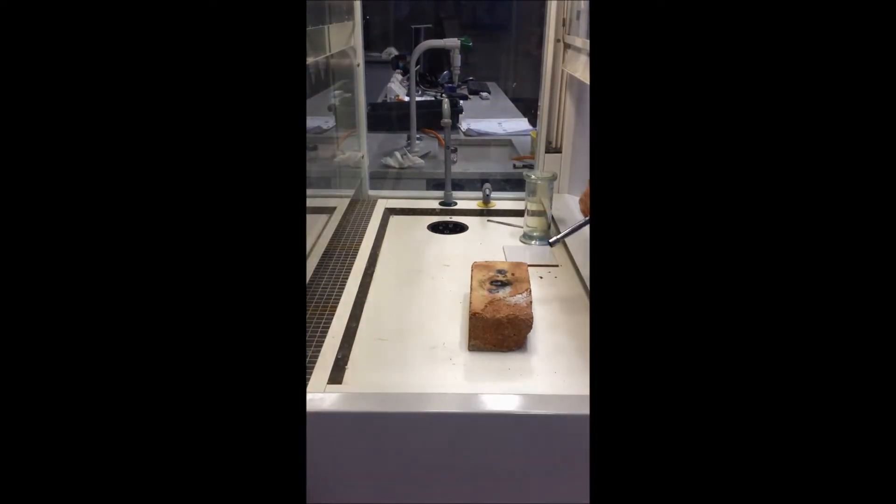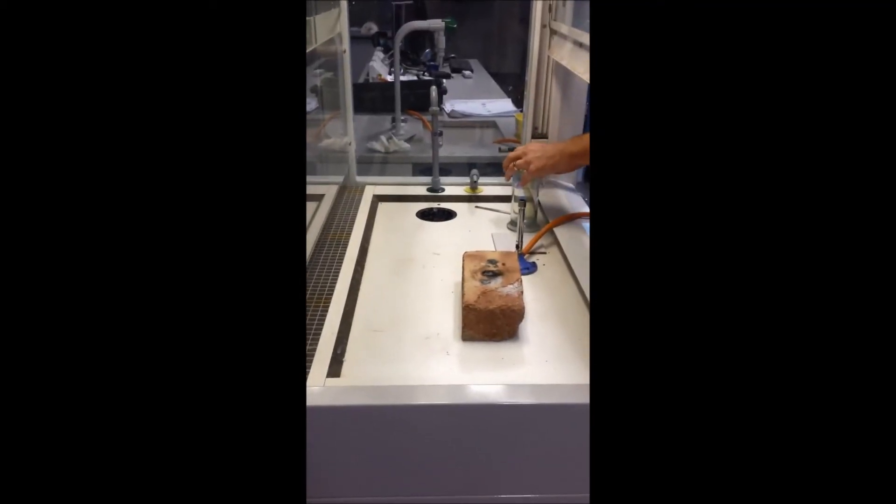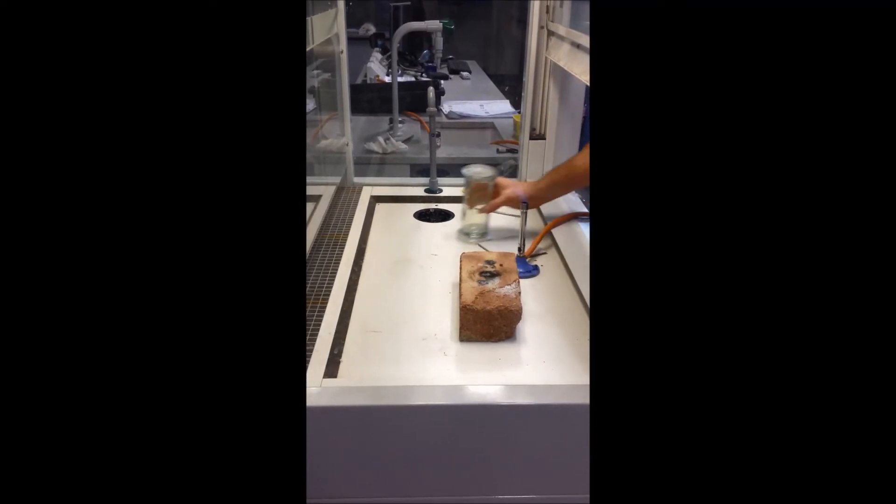The first thing we're going to do is set fire to our sodium. We're going to get it molten and ignite it.